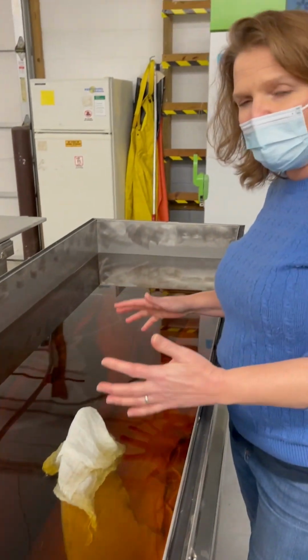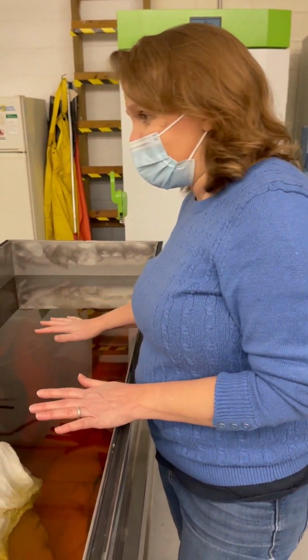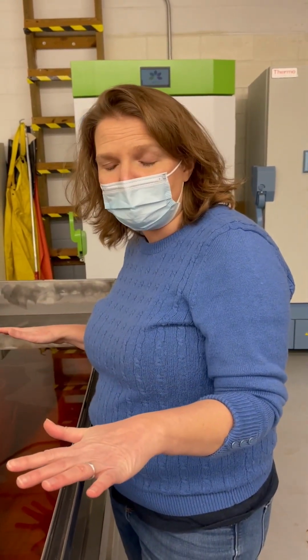Their livers are humongous compared to other fish, and they have a lot of oil. So when you put them in ethanol, a lot of that oil will leach out, and that means that you get these oil slicks. So a couple coffins where we have maybe 10 or 12 sharks, you'll have a very thick layer of oil that's across the top of them.